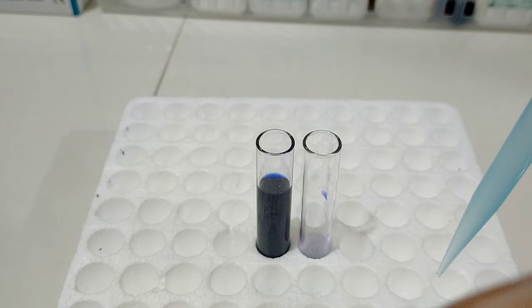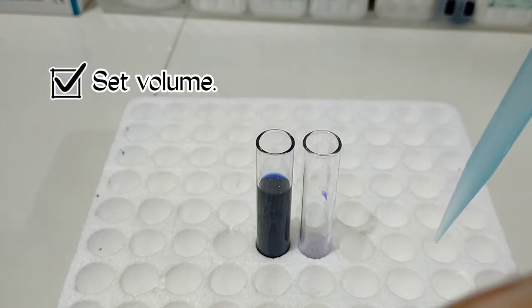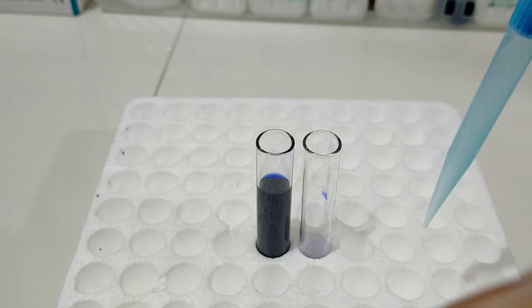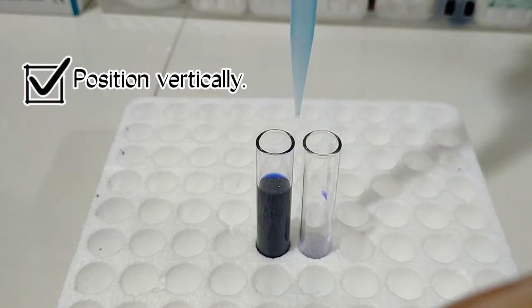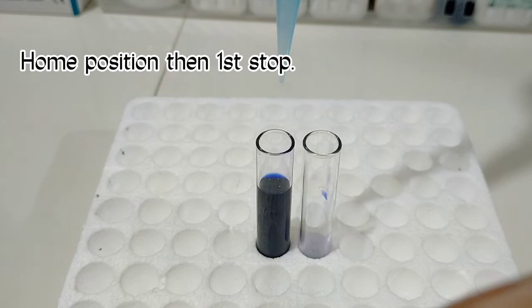The first thing you have to do is set the required or desired volume, and then position your pipette vertically onto the glass tube containing the liquid solution. From the home position of the push button, push until the first stop.